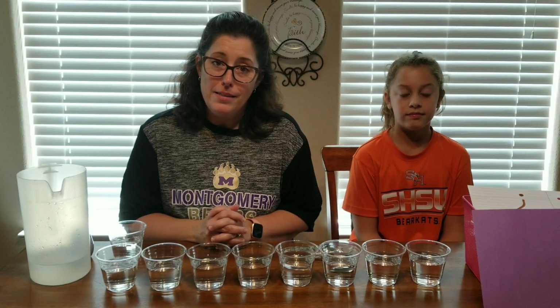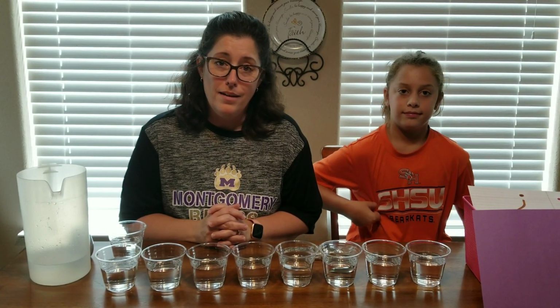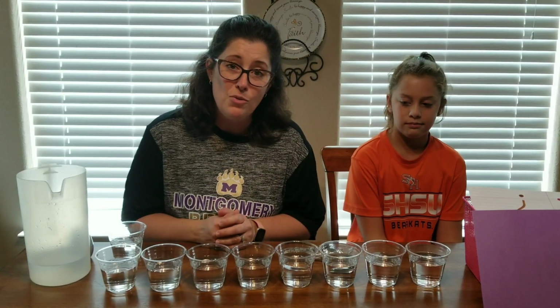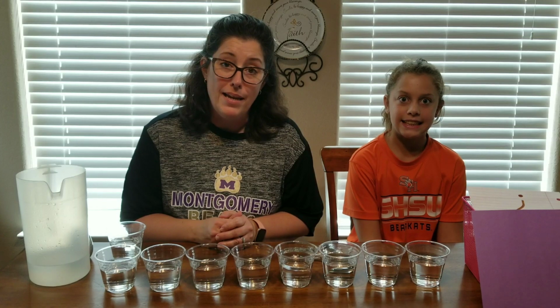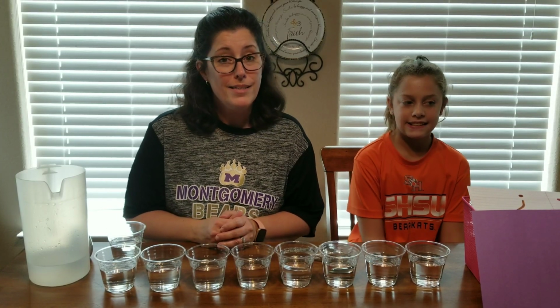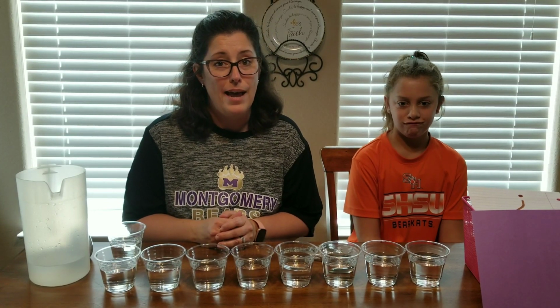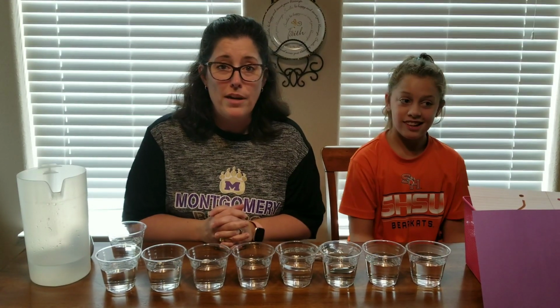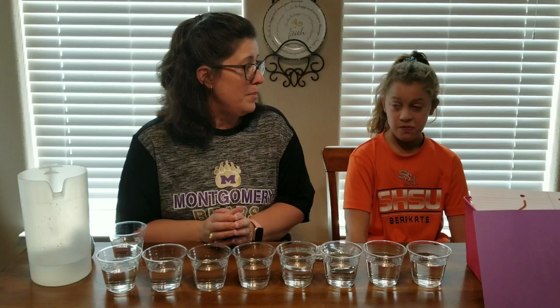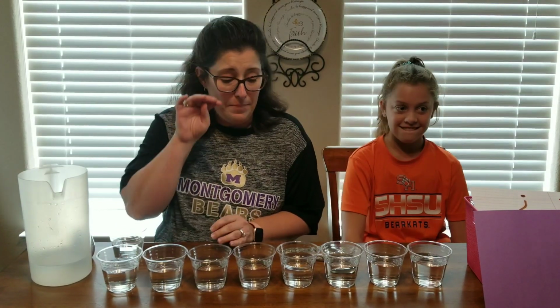Friends, Miss Scott here. Today I'm going to be attempting a lab demonstration for you over properties of matter. My teammates, Miss Knowlton and Miss Allison, don't live here at the house with me, so I'm not able to do a video with them today since I'm working from home, but I have a special guest from Miss Allison's homeroom. You may know my daughter Carly, and she is going to help me out today. She's going to be my volunteer lab assistant.